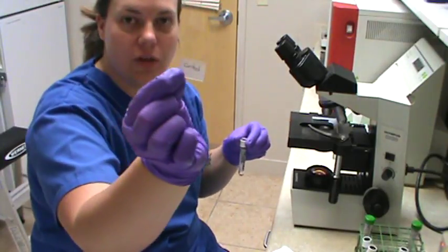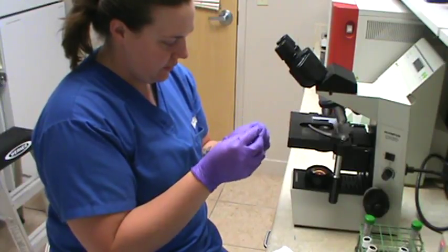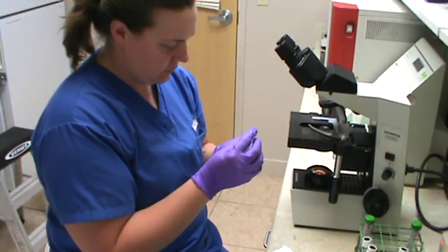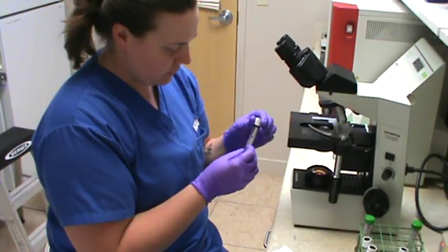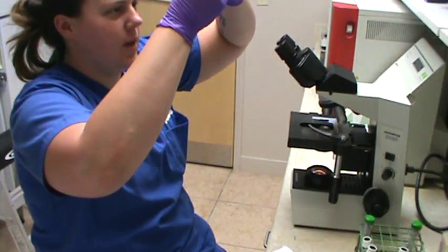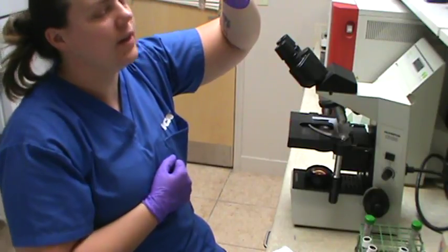We're going to resuspend. Alright, so I'm done resuspending it. We're going to take a peek macroscopically. And again, nice and mixed.